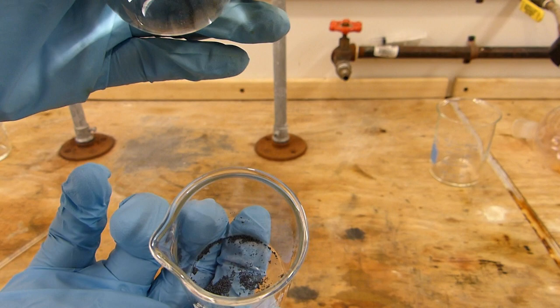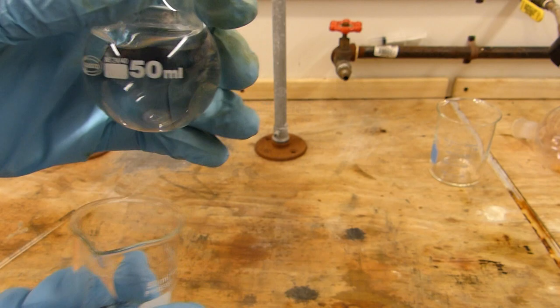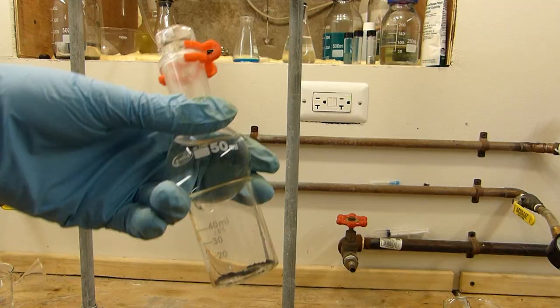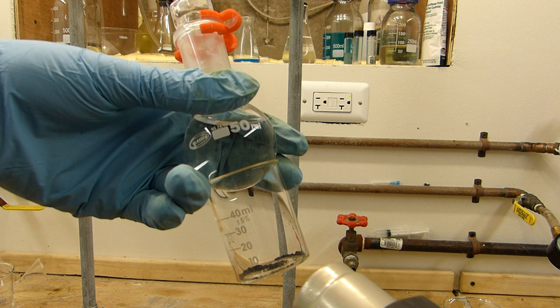So I'll run it on a very small scale here right now just to demonstrate the concept. But because I lack the apparatus - I'm still counting my pennies to get a decent sublimation apparatus.